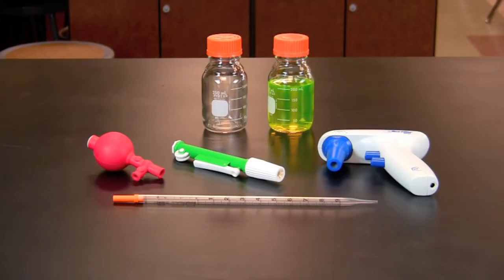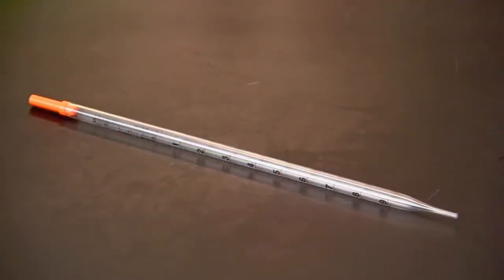In this video you will learn how to use a serological pipette in a variety of pipette pumps. Serological pipettes are a type of graduated pipette commonly used to measure volumes over one milliliter.